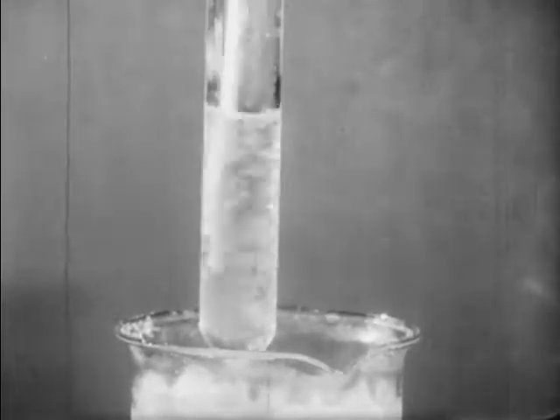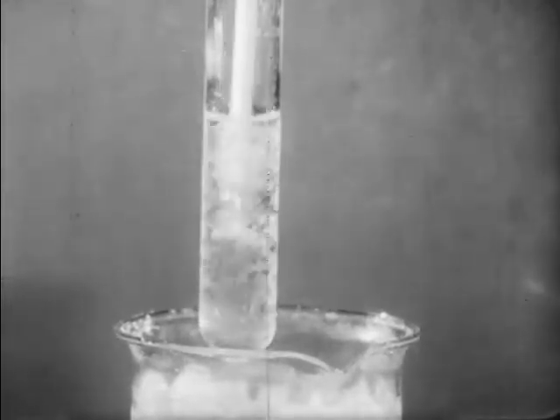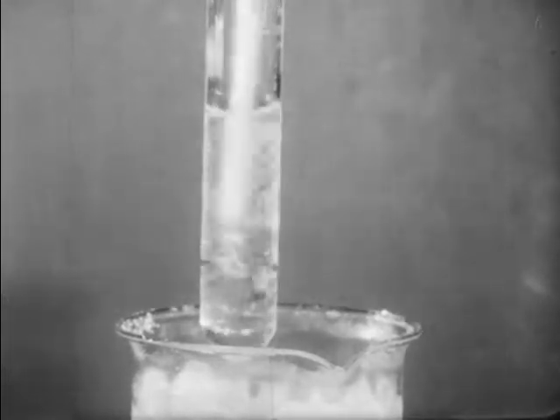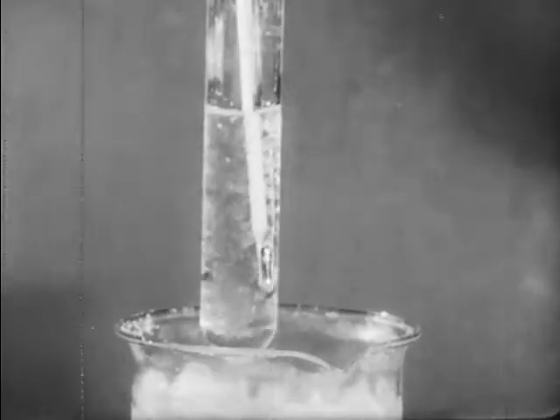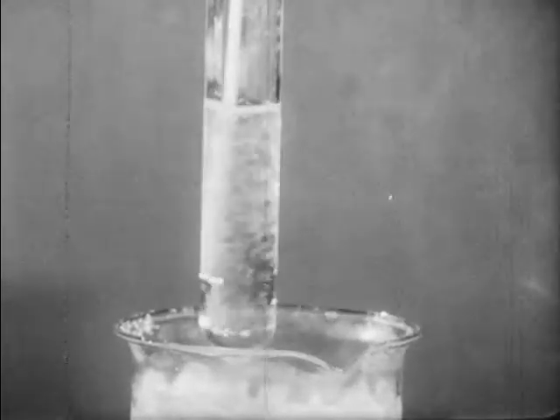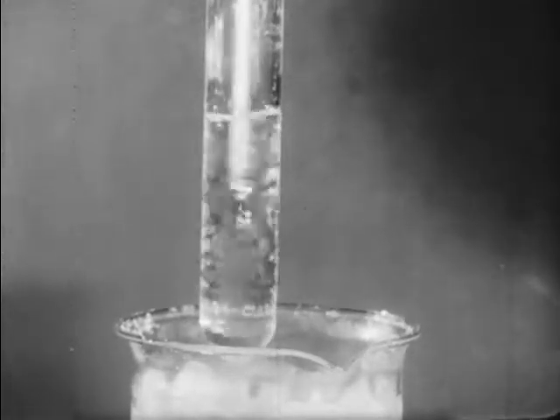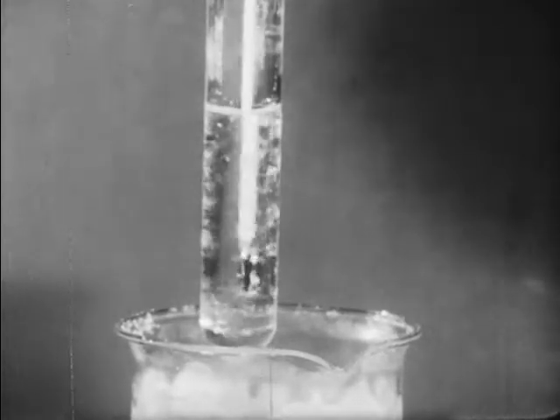I think you can plainly see the crystals of frozen pure solvent, in this case ice, and the fact that there is plenty of solution left. The temperature at this point will be the freezing point of this solution. And reading it from the thermometer, we find it to be minus 4.4 degrees. We know then that the amount of urea that we added to 25 milliliters of water depressed the freezing point so that it now reads minus 4.4 on this thermometer.